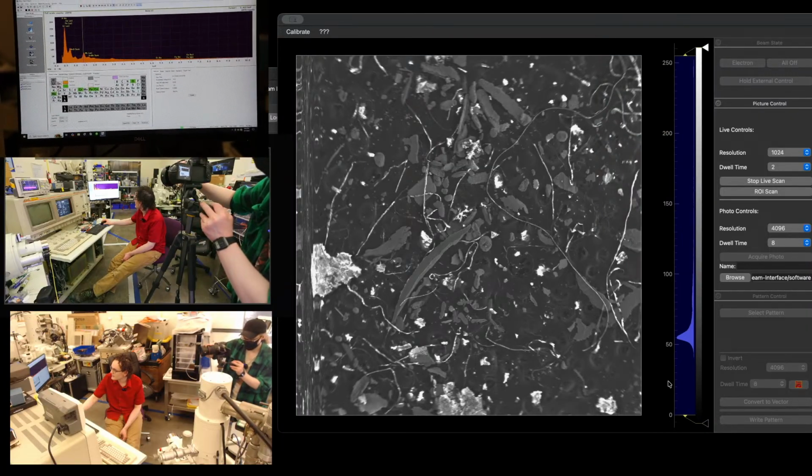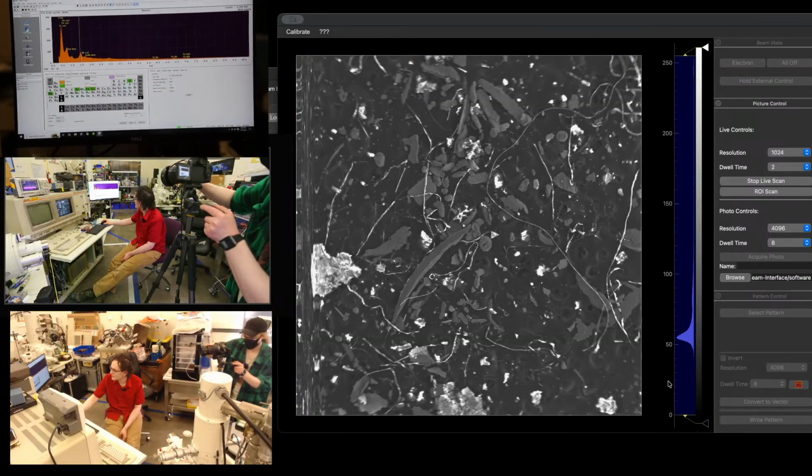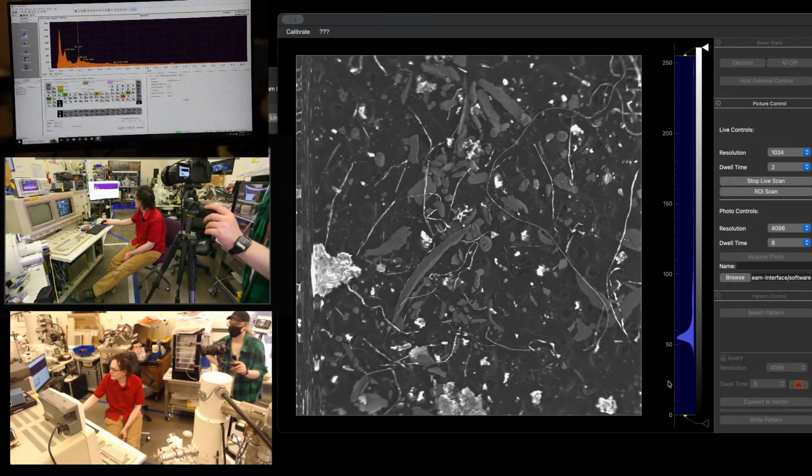Don't know what that peak is yet. I think that's probably an aluminum peak. No, aluminum's not showing up, or that's not aluminum. Let's see here. Okay, it's starting. Yeah, that's not. Neither of those are what's going on. Okay, it's getting a little bit confused. I don't think we have enough counts, or it looks like the peaks we want are a little bit buried. So we can let it capture some more.